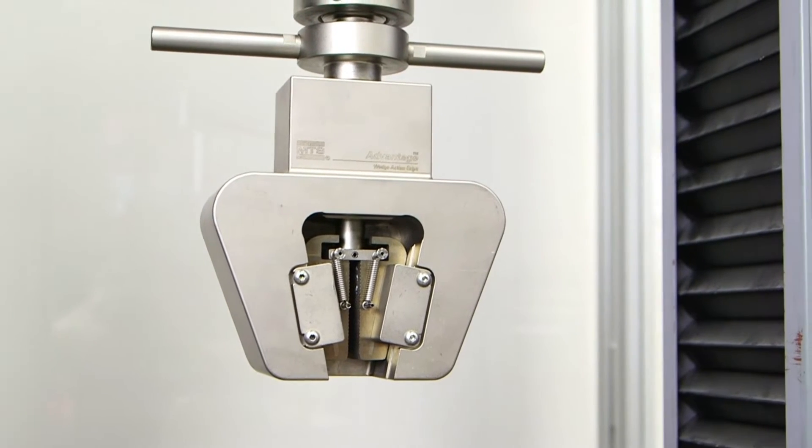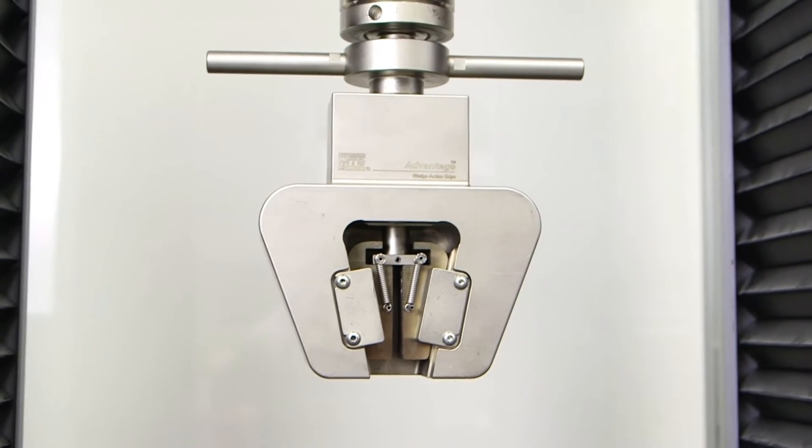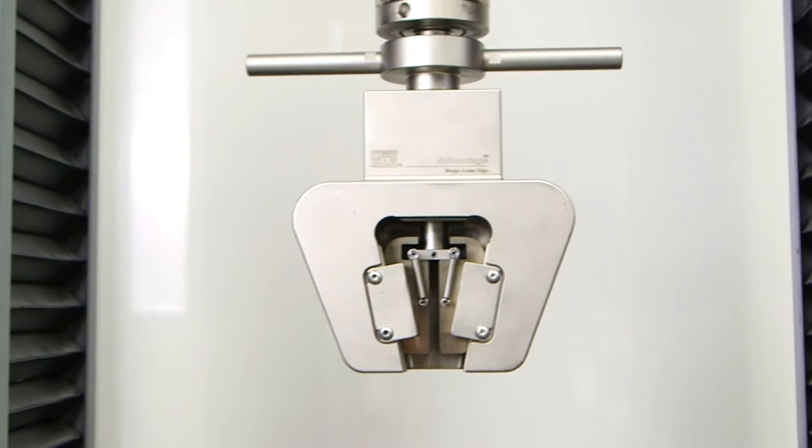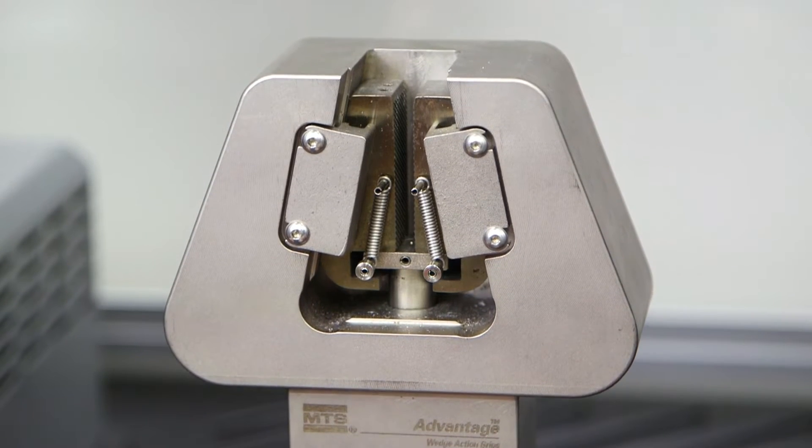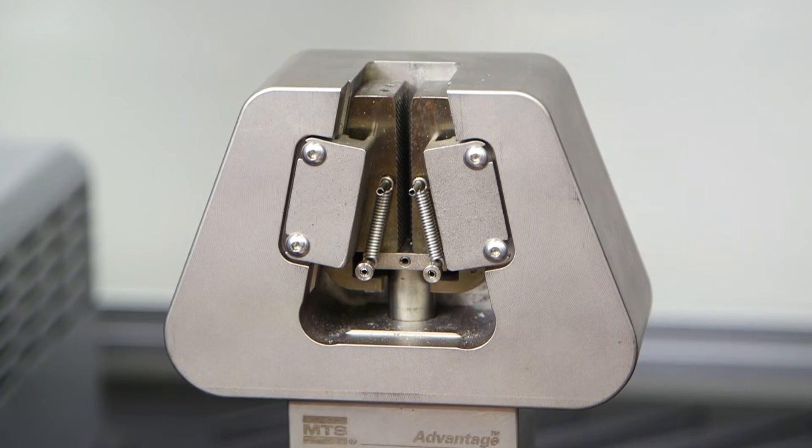Grips are attached to the load cell and the base of the frame. Today we will be using MTS Advantage wedge grips. These are a mechanical wedge grip. They are easy to use and do not require any additional equipment such as pumps.